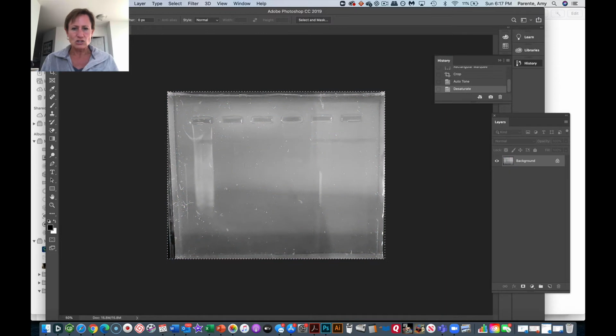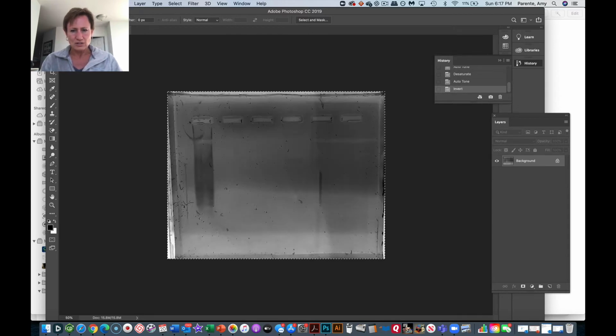Now I'm going to desaturate it. So that's what that does. I'm going to try fixing the levels again, see if it adjusts anything. Yeah, we'll go with that. And then I'm going to do an invert. And we'll try fixing the levels there again. So now what it does is it takes these bands that were light before and makes them dark.